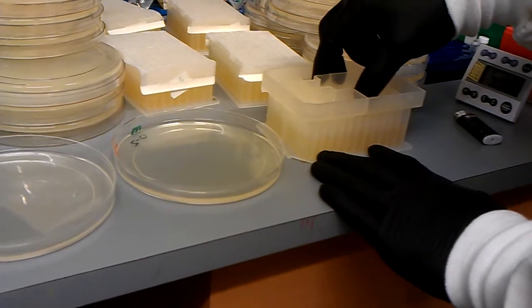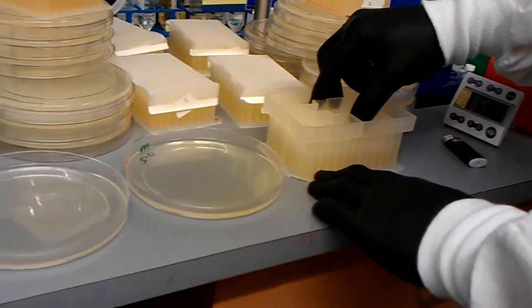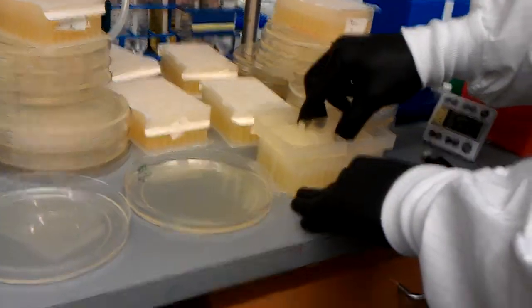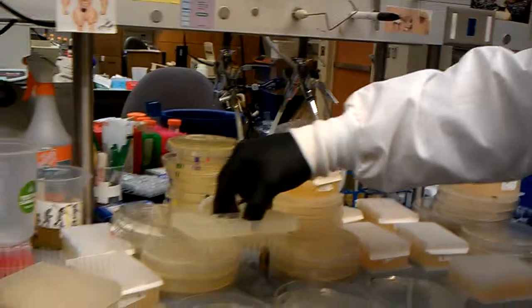And this is sort of inexact. We're just trying to get an idea of the antibiotic resistances in this particular screen. Every screen is unique though. Pull it up, and there is now culture on every single one of these.